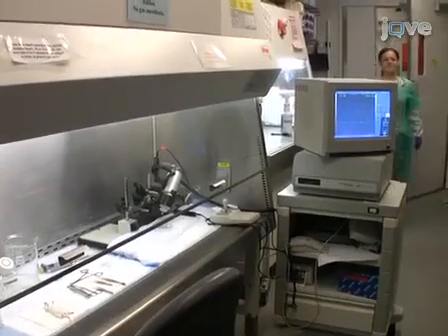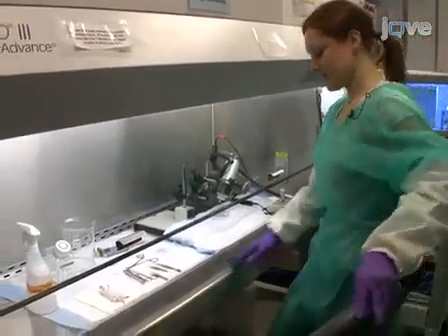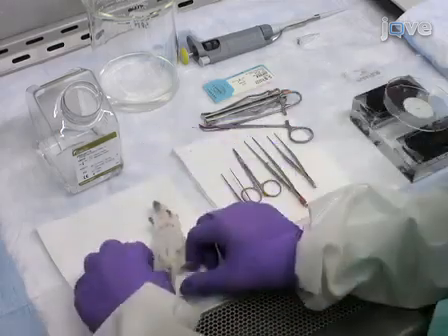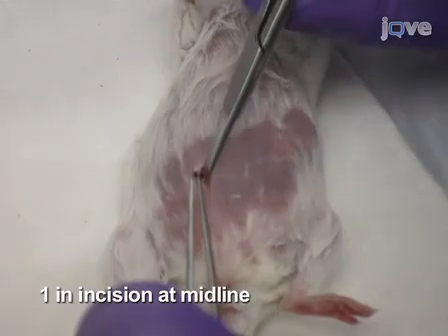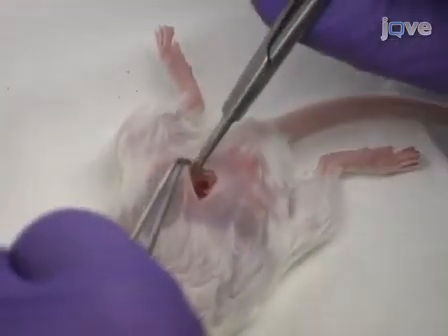If the injections are to contain engineered viral vectors, the procedure should be performed in a biosafety 2 cabinet. Place an anesthetized pregnant mouse on its back. Use fine surgical scissors to make a 1-inch longitudinal incision through the skin at the midline. Cut away the connective tissue located between the skin and muscle surrounding the incision.